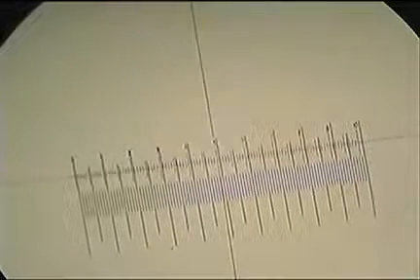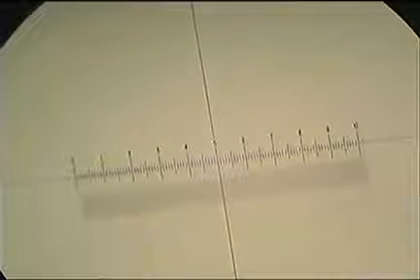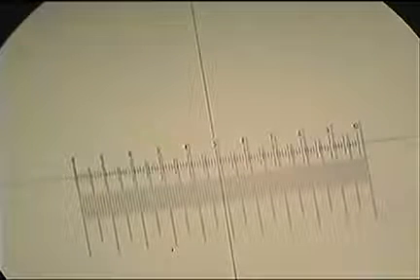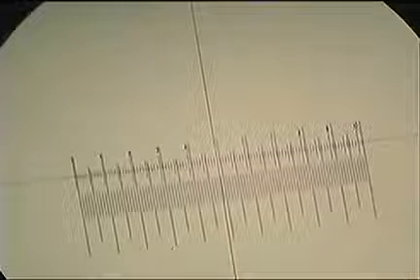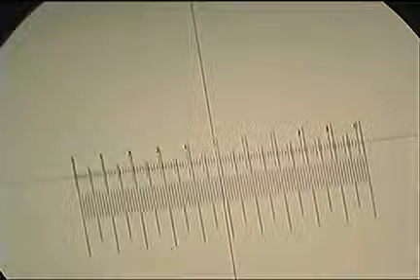And the entire stage micrometer, which is 10 of those larger ones, is obviously then 1 millimeter. So the smallest unit is 0.01, the next largest, there's 10 of them across there, is 0.1, and the entire thing itself is 1 millimeter. So looking at where it lines up, I'm looking for two lines that line up.